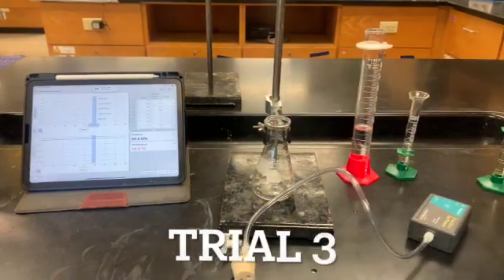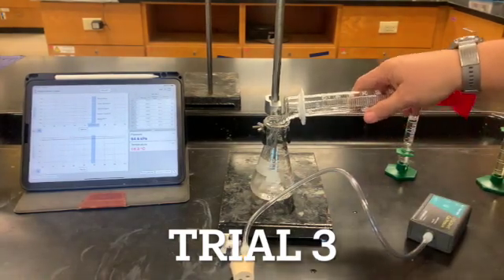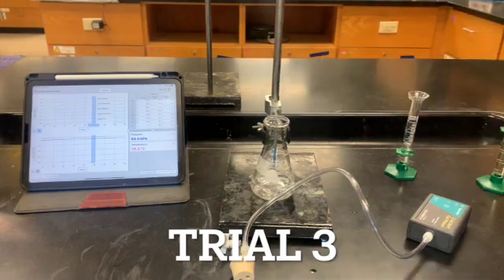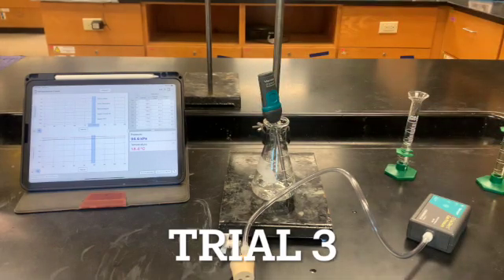Okay, trial 3, we're gonna have our 45 milliliters of water. Again, we're gonna get the temperature of that before we start. And then we're gonna add 5 milliliters of hydrogen peroxide.